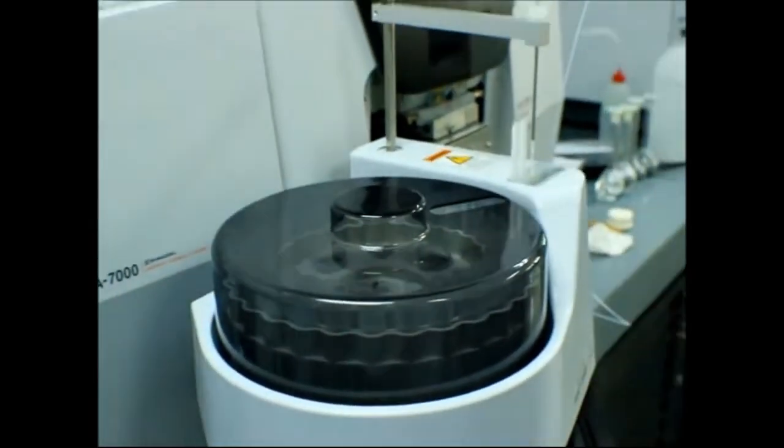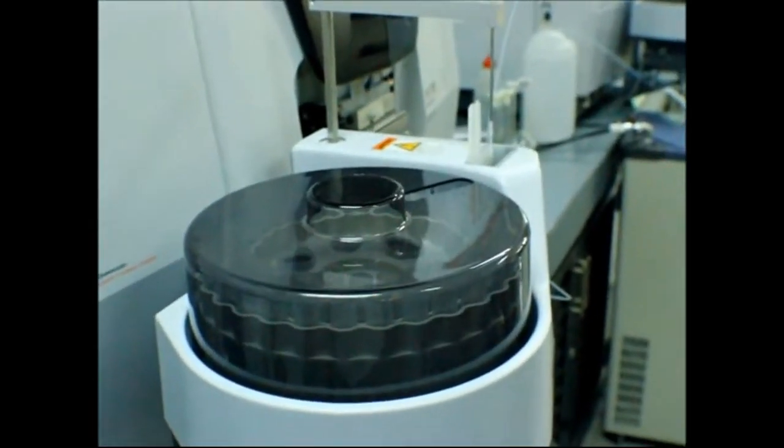This one is out, correct? Sorry? So just jump up. Yeah, later they will move to different positions to get your standard or sample. Okay, now I think we can start our analysis. So I'll try to run. Okay, how to start our analysis? Very easy. You just need to click start.